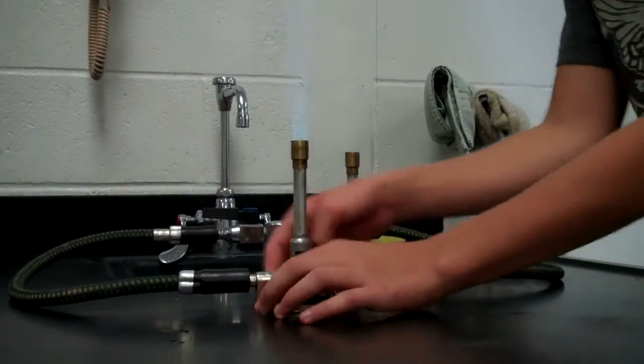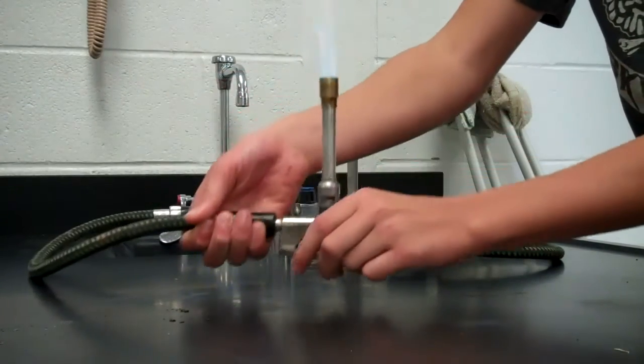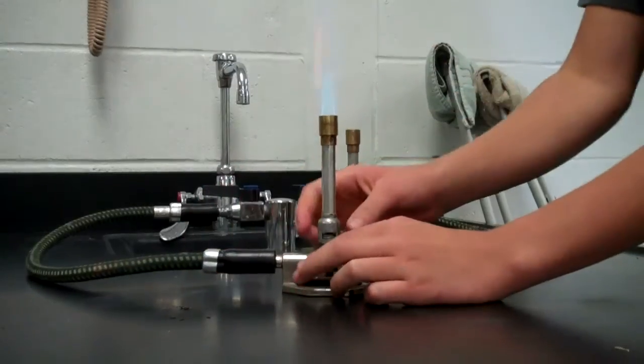If you feel safe enough, you can turn it and burn the table. Just don't keep it in one spot. It'll die. Shut it off.